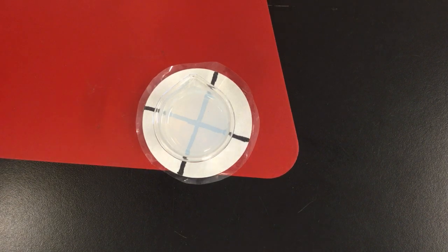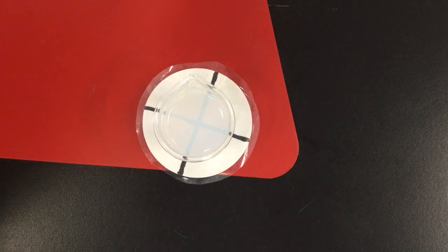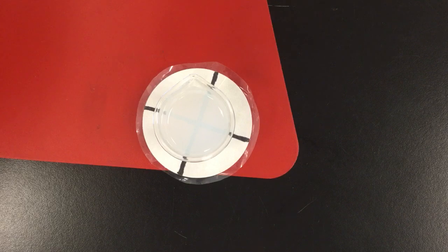All of the sulfur in the sodium thiosulfate is starting to separate and become pure sulfur, turning into a powder, making it harder to see through. I can still see the cross though, so it's not quite there yet.